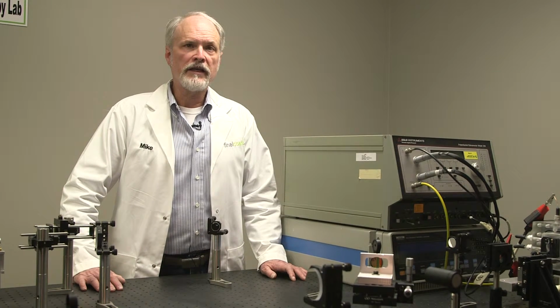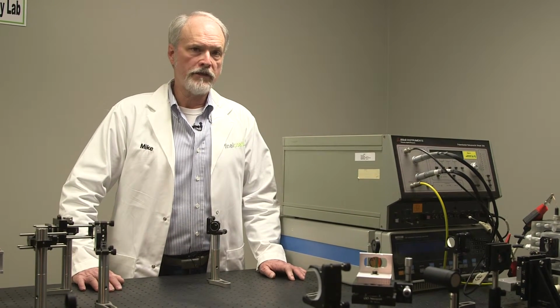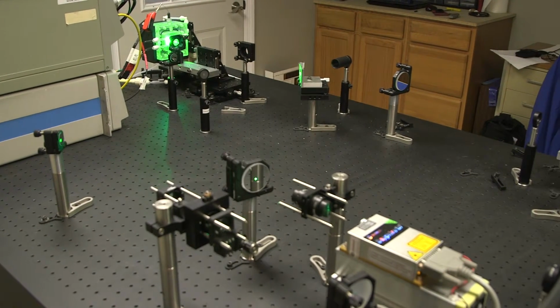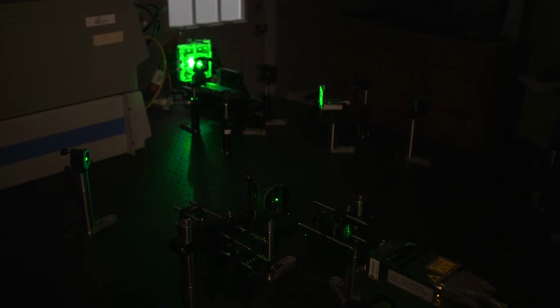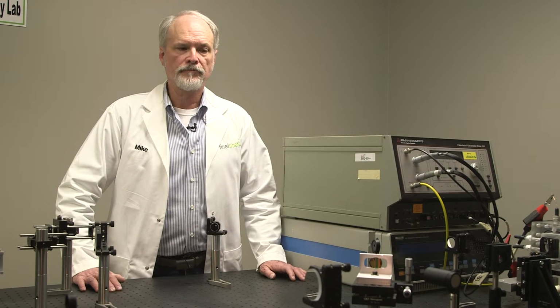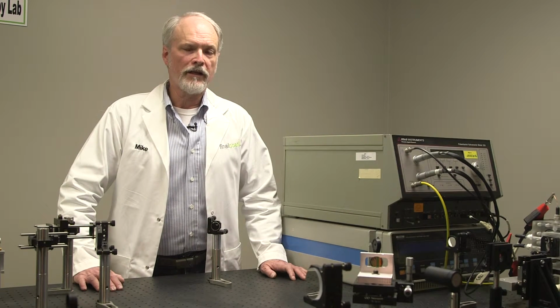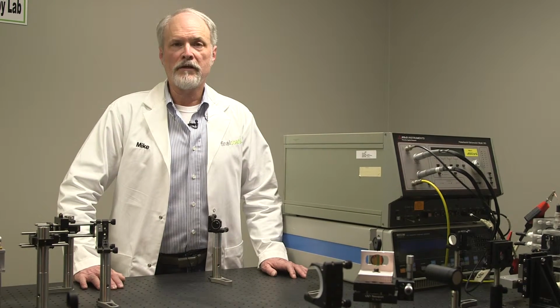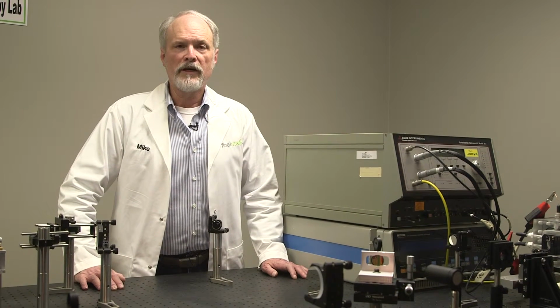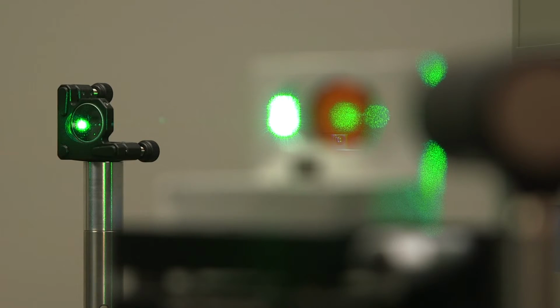And all molecules have a characteristic shift. And so if you look at the reflected light that is shifted, in our case we're looking at the light shifted towards the longer wavelengths. If you look at that spectrum of the light from that surface, you can actually determine the optical signature of that material or the molecule that's on the surface. So it's a very clever way of finding out what kind of molecules are on a surface while the steel or zinc or whatever is corroding. It takes quite a lot to do that.